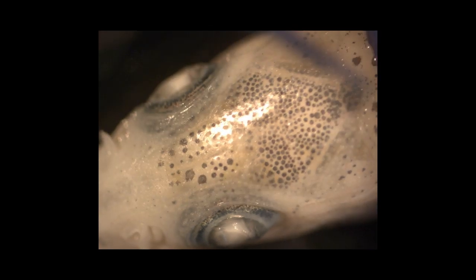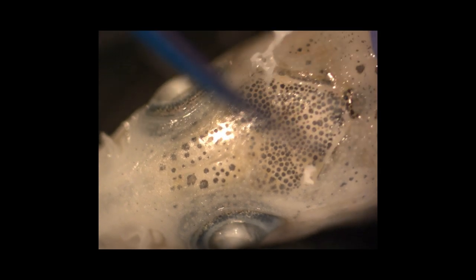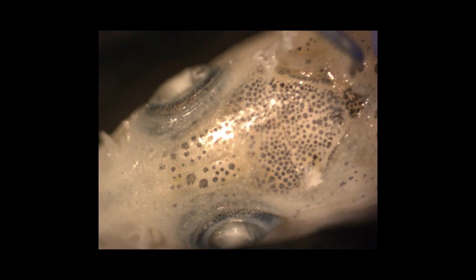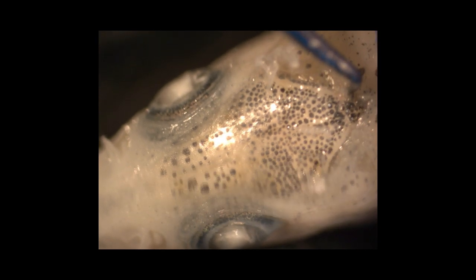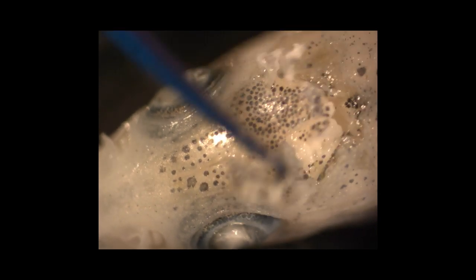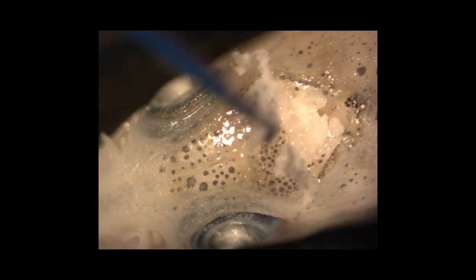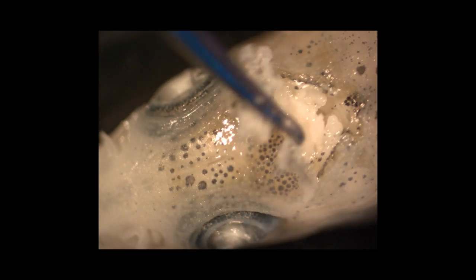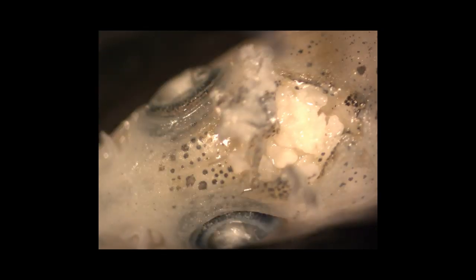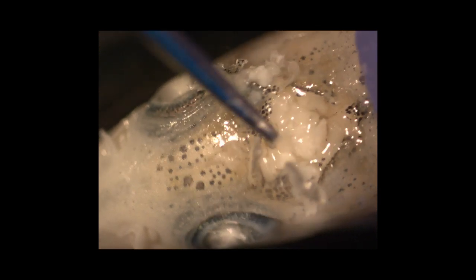So the first thing I'm going to do here is scrape away a bit of the skin off of the supraoccipital crest before I make a small puncture just behind that series of bones. And then kind of gently push away that bone from the brain. I like to get the majority of it out of the way to give myself a little bit more room to push material around and open up that cavity to see the otolith a little bit better.